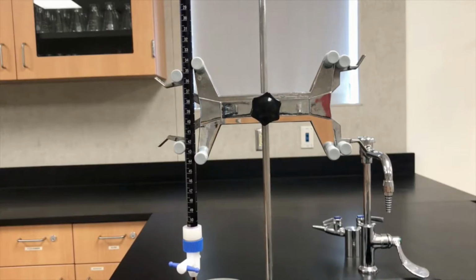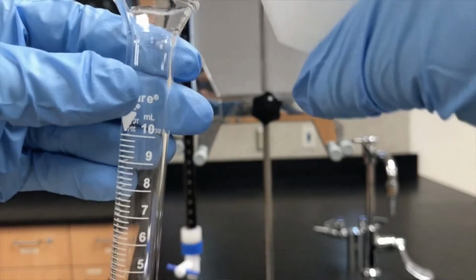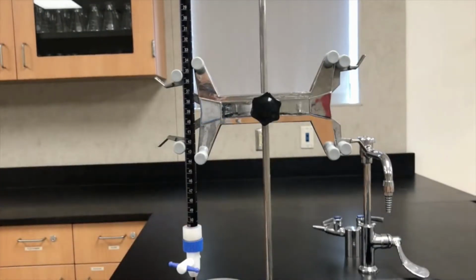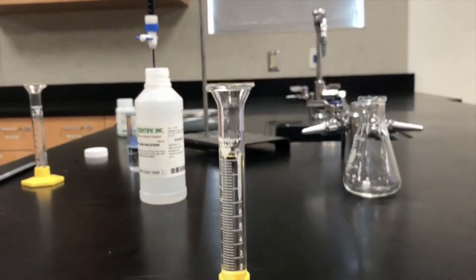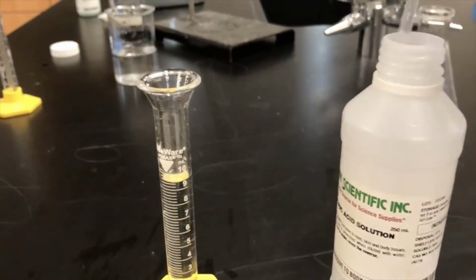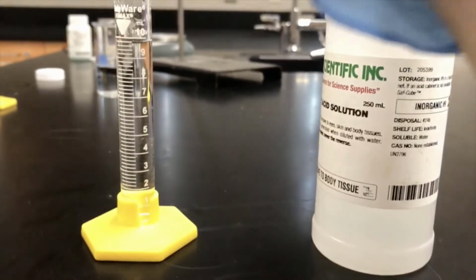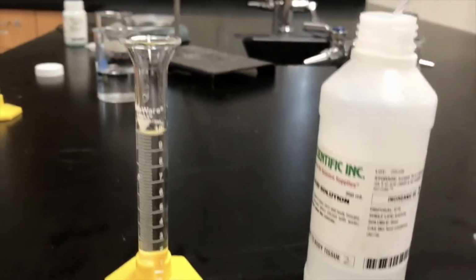So I've got one graduated cylinder right here. That's a 10 mL. I'm going to pour 10 mL in. Now remember, you need to put it on the table. Let me show you. You need to squat, make sure that you're eye level, and notice I'm not at 10 mL. A great thing for you to use is just a pipette, okay? If the volume's getting kind of tricky to get, because I want exactly 10. Okay, and I squat. And there we go. Okay, there's my volume.